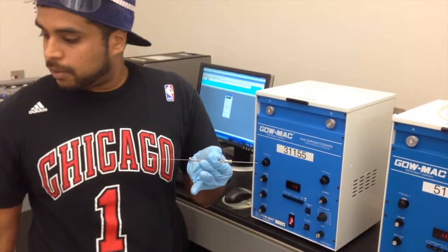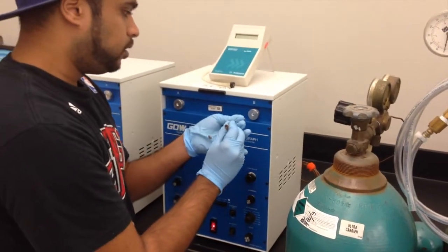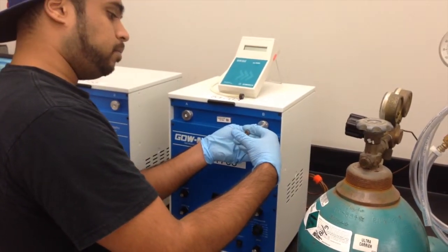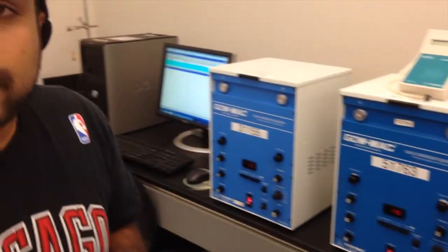Am I going to A or B, Dr. Mondre? Go into B, and then you use that, and I'll go ahead. So we insert the syringe all the way down, and whenever you're ready, put the plunger all the way in. Once you do that, the computer will do its work. And then you repeat this process again with each of the different vials.